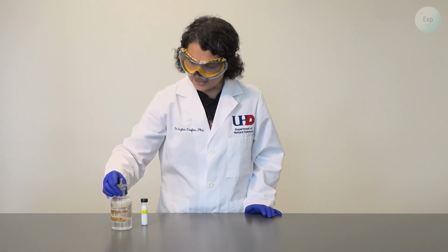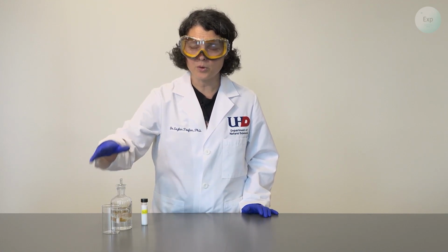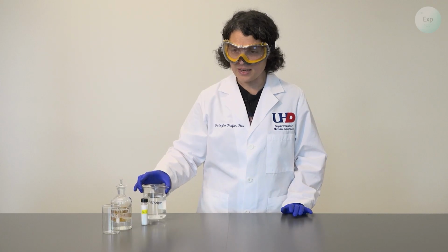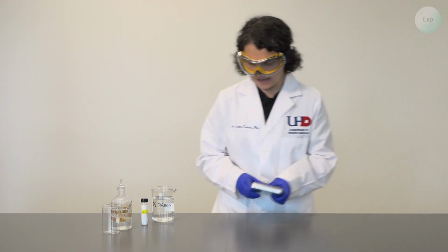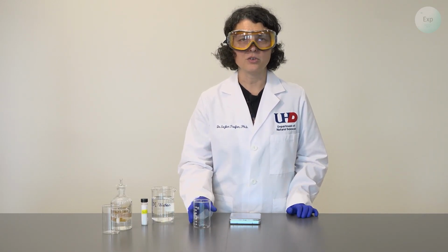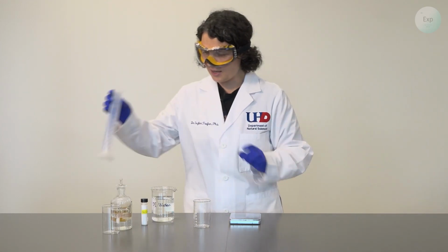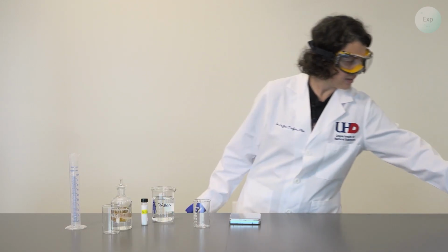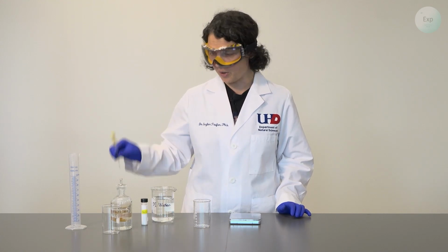We are going to use a concentrated hydrochloric acid solution, which we will pour right before use into a small beaker. And we will use some deionized water. For equipment, we're going to need a scale. We will measure our sodium chloride directly into a beaker because we will be measuring 18 grams. We will need a relatively large 50 or 100 milliliter graduated cylinder. And to add the hydrochloric acid dropwise, we're going to use a pipette with a bulb.